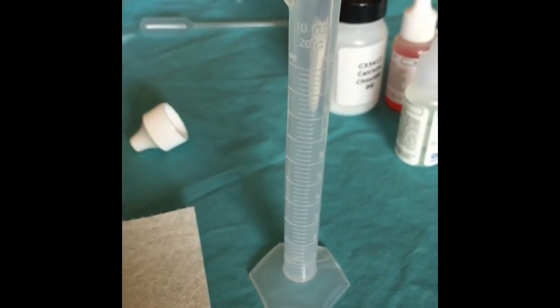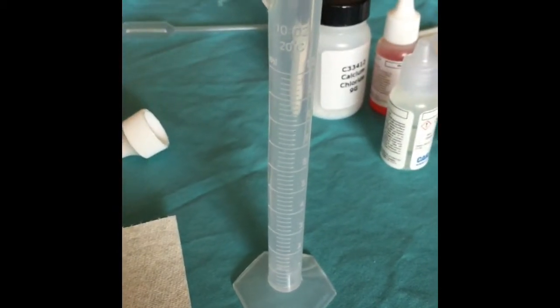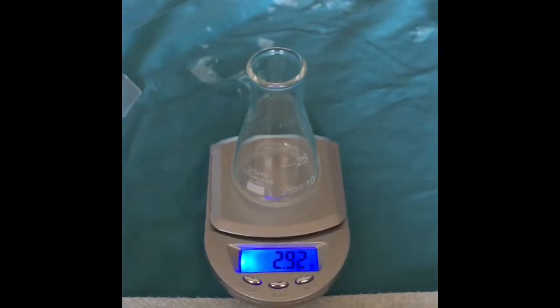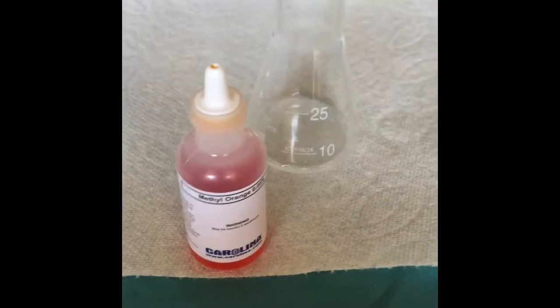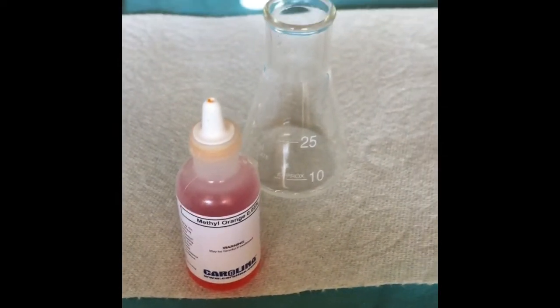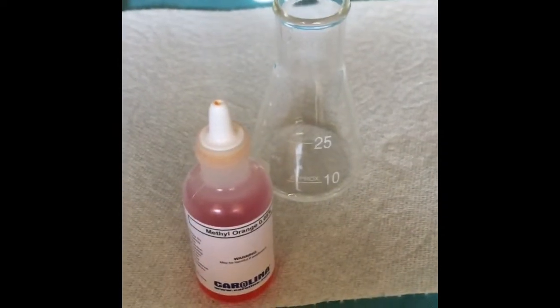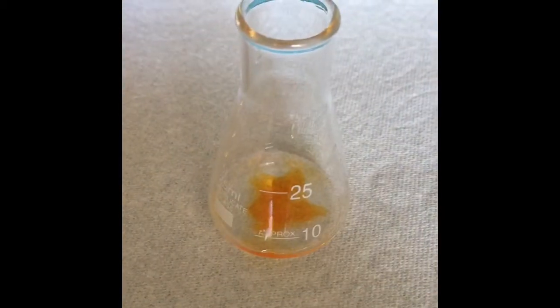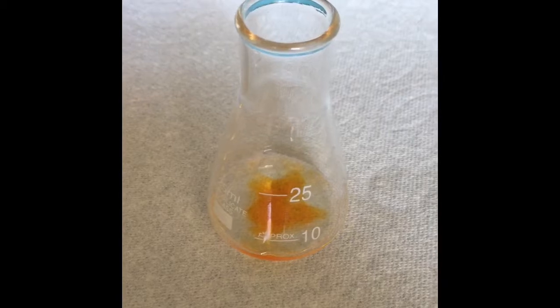Okay, I'm beginning activity 1, the titration of saturated calcium hydroxide with hydrochloric acid, by adding 3 milliliters of lime water into the 10 milliliter graduated cylinder. I am now finding the mass of the 3 milliliters of lime water. I will now be adding 5 drops of methyl orange to the 3 milliliters of lime water. And here's what it looks like when the methyl orange is added.